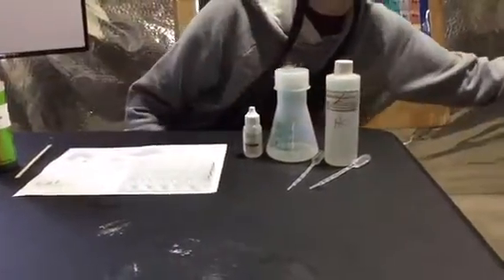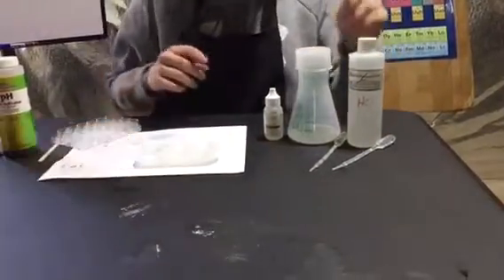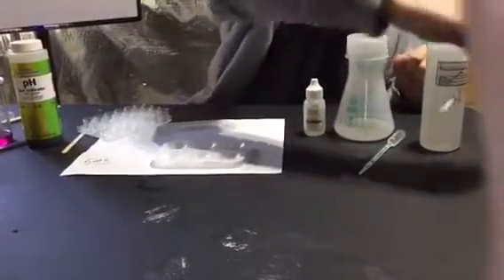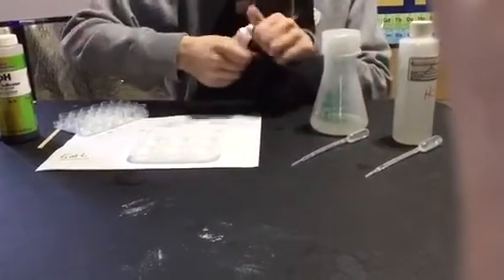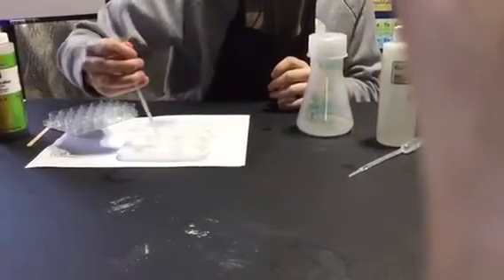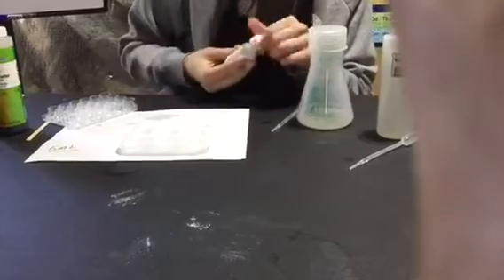Get one of those white paint palettes. She's going to put a little acid in - that's HCl - and a little base. She's going to put a little phenolphthalein in with the acid, and notice it stays clear. Now go ahead and put your base in. It starts off clear - now watch what happens when she puts a drop of phenolphthalein in. Notice you get a color. We use this indicator because it's clear in an acid, but it turns this vivid pink in the presence of a base.